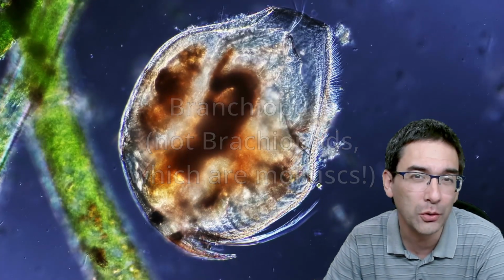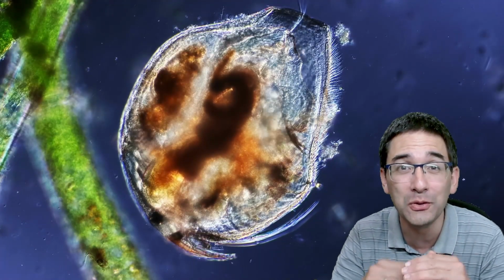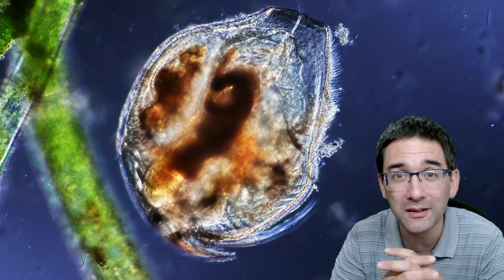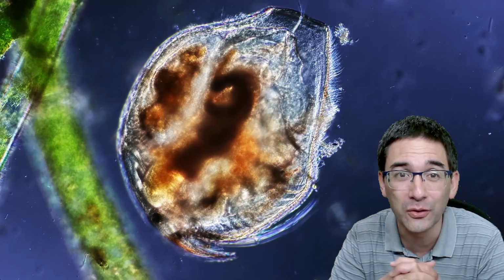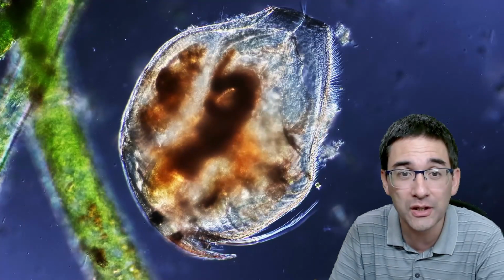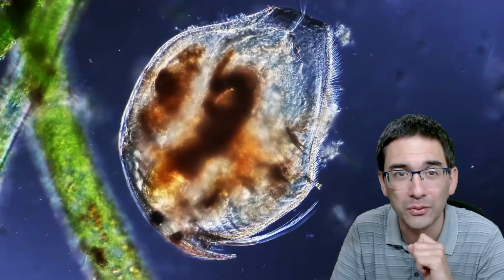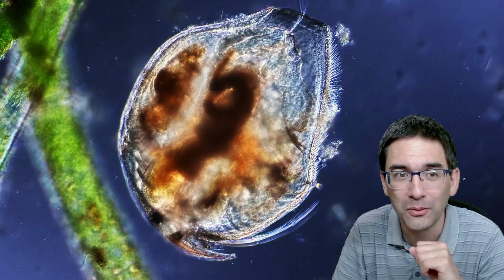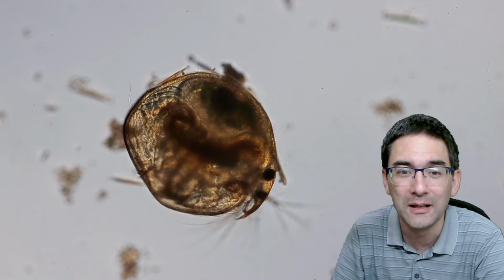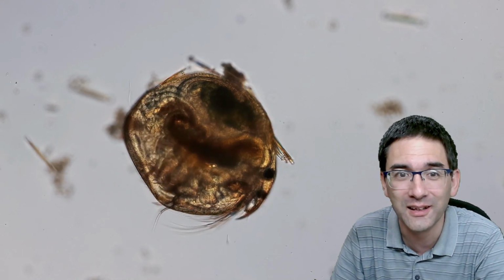And they were not moving around in a very jerky manner. Why is that? Because they were squeezed between the cover glass and the slide, and therefore their movement was inhibited, and it allows you to observe quite well what's actually going on inside the little water crustacean. I found several of those. You can also see in comparison, all the way on the left side, some algae here. You can see how big the individual cells of the algae are. Here's another one. I've made several videos already about those before. I think they're quite nice to observe.